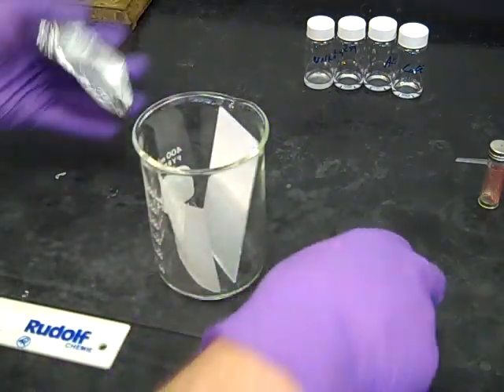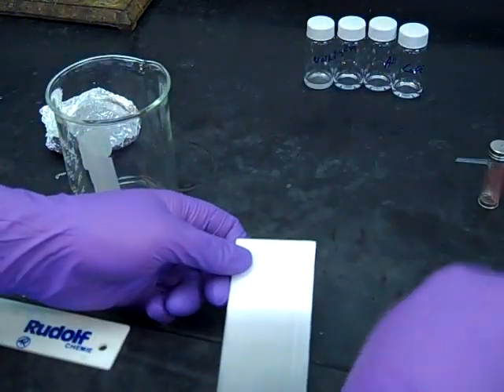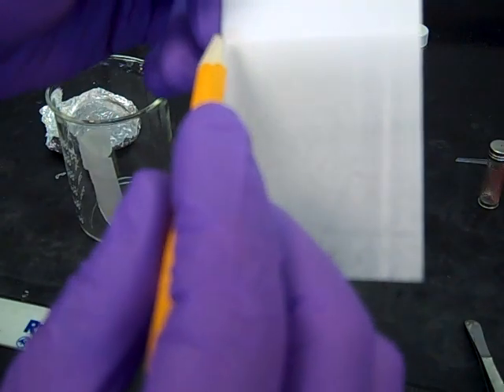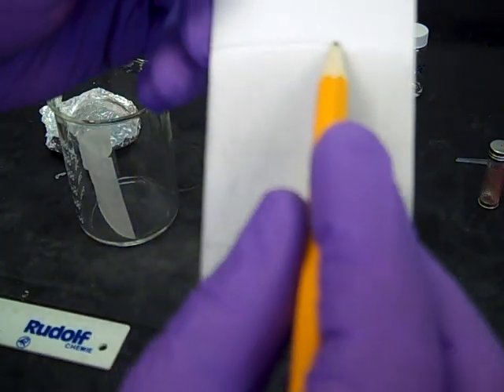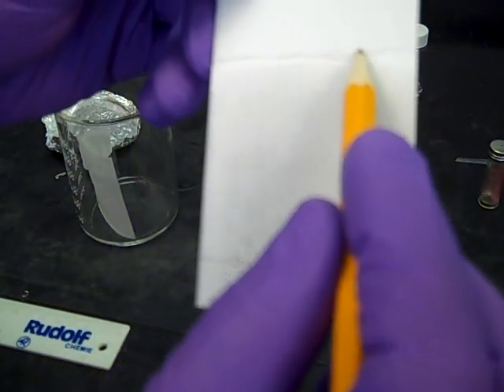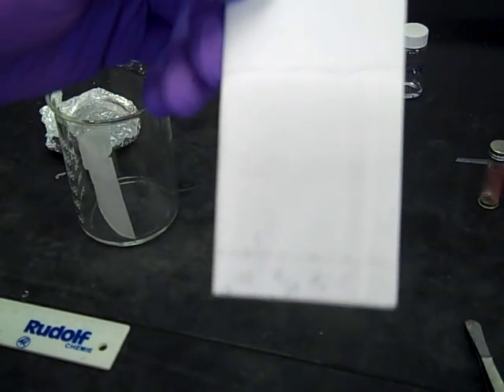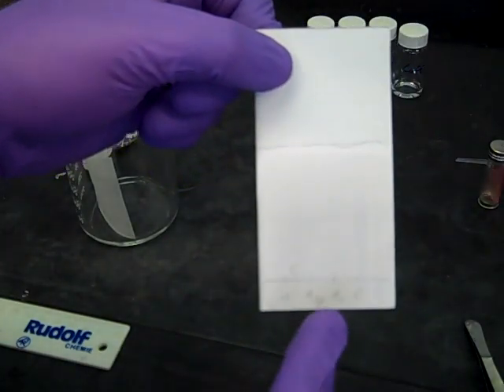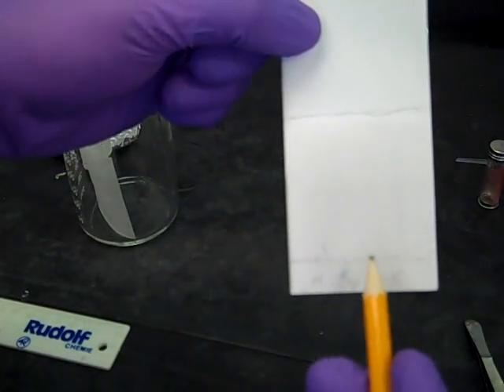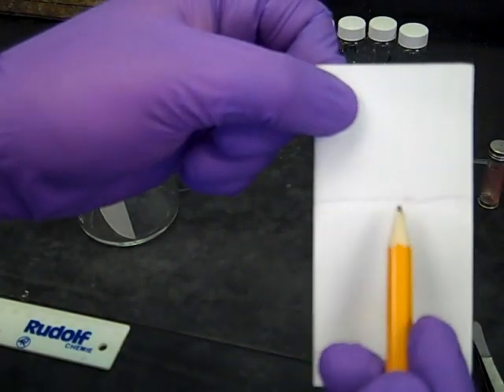Where that solvent line is, I'm going to draw a line with my pencil. You can see we started down here and the solvent finished right up here at the top.